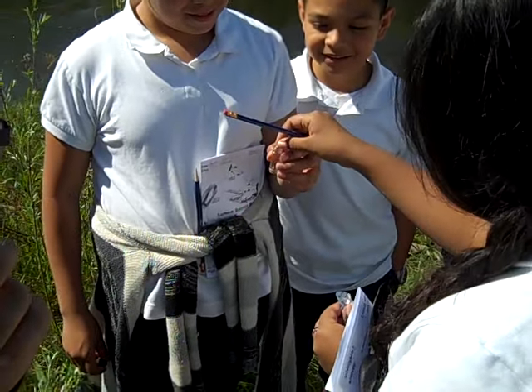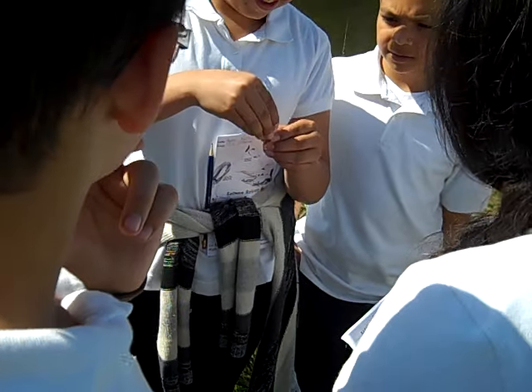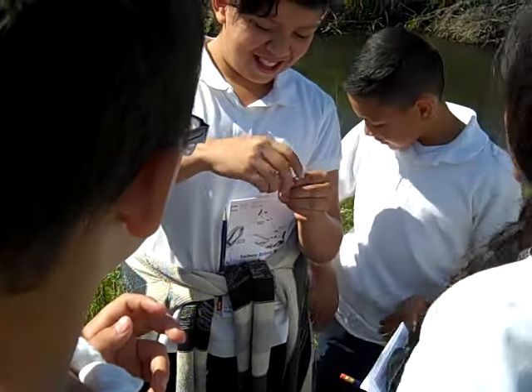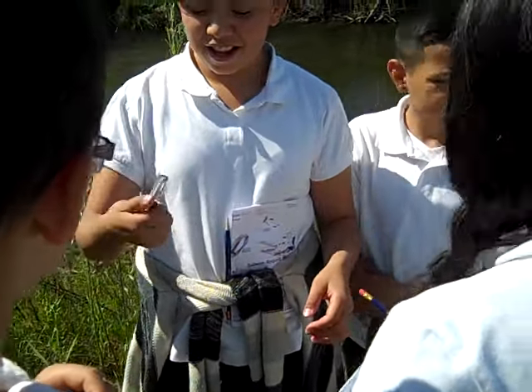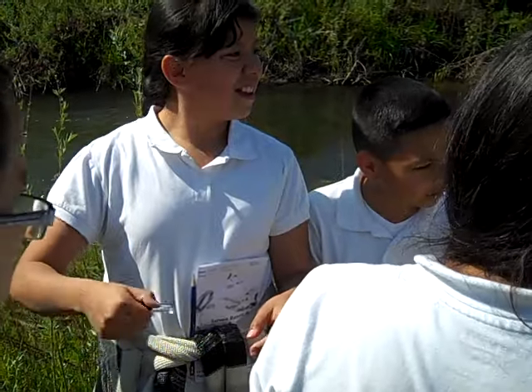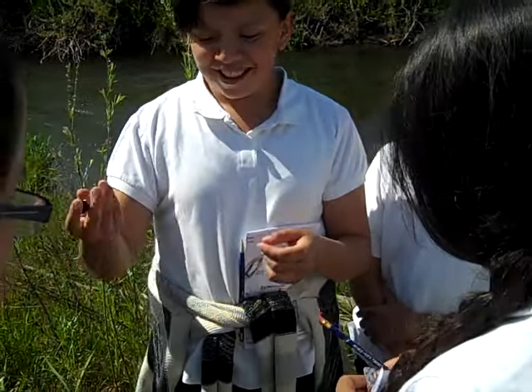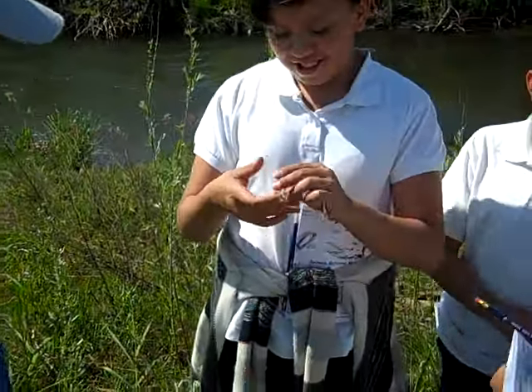Okay, put those guys in there. And then we're gonna put the cap on. And then you're gonna mix that up as good as you can. Just shake it, tip it upside down, until it dissolves. Okay. So that's going to take a couple minutes before that dissolves. You can put that back. And while we're doing that, we can do our other test here.